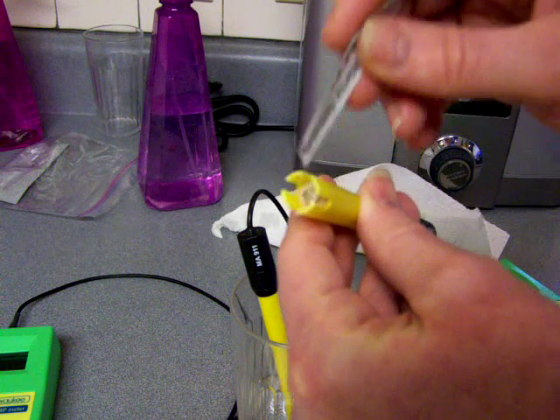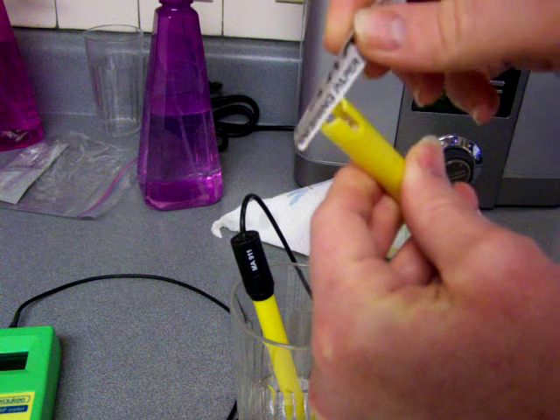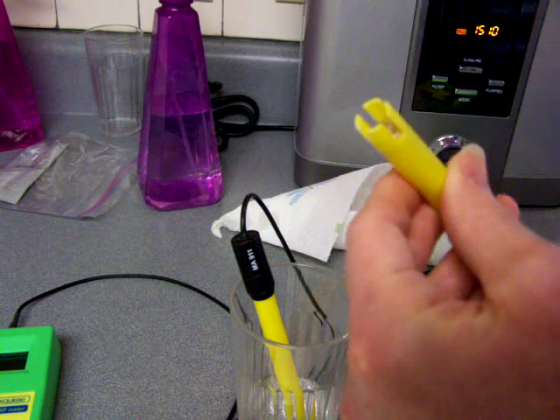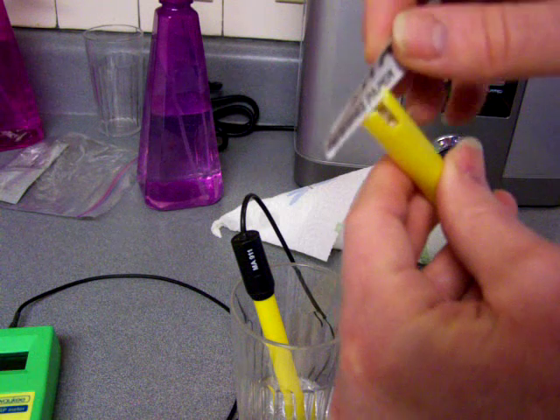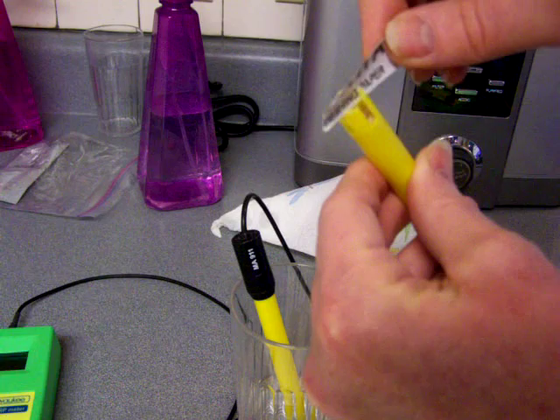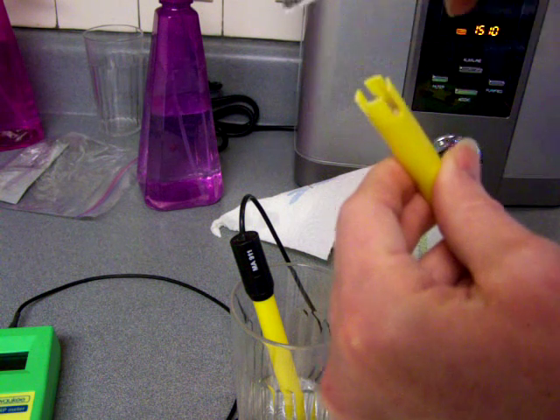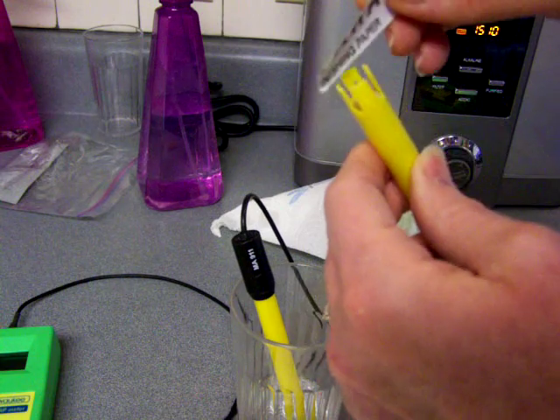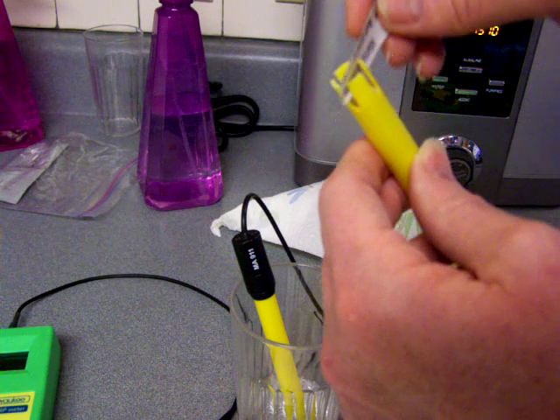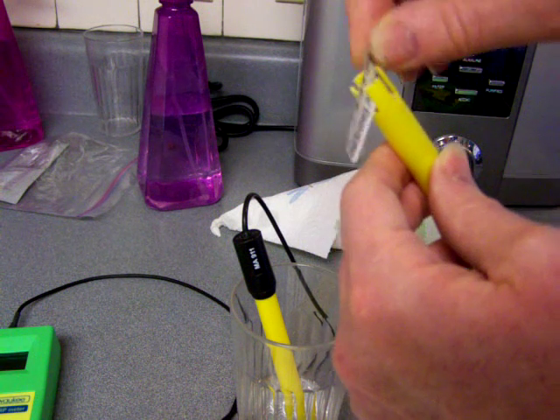and cut it into little strips like this. And then I just go, there's little grooves here on the sides of the probe, and I just kind of go in the grooves and just do very light swishing and sanding. Very, very light. Not hard. I don't want to go so hard that I remove the platinum, of course. I just want to lightly polish it and get that calcium off.